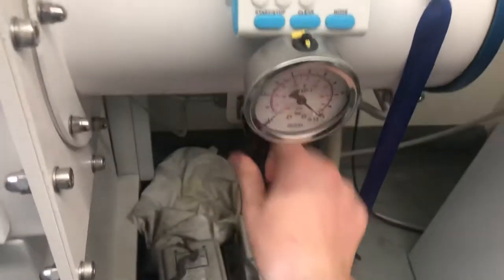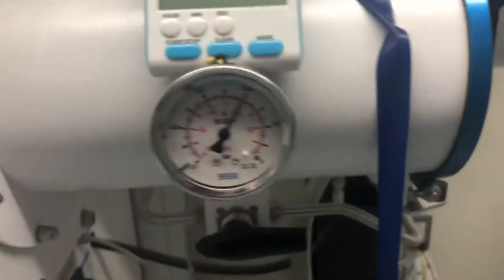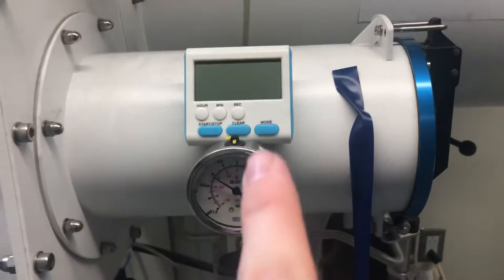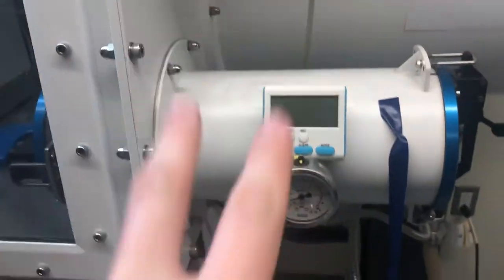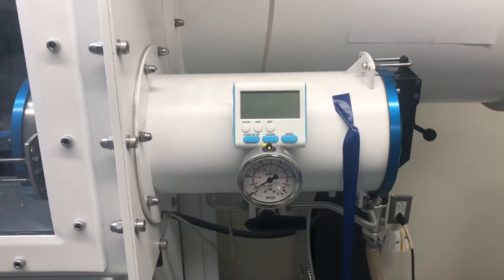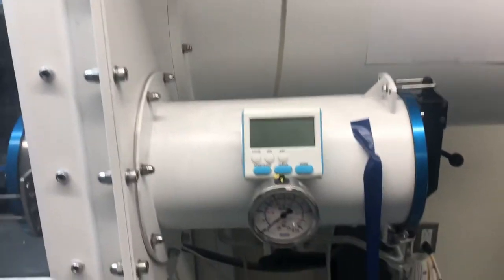Then you want to immediately pull vacuum. And this first vacuum pull will be for 20 minutes. You're going to pull 20 minutes and then you're going to open it to argon. So I'll show you what that looks like.